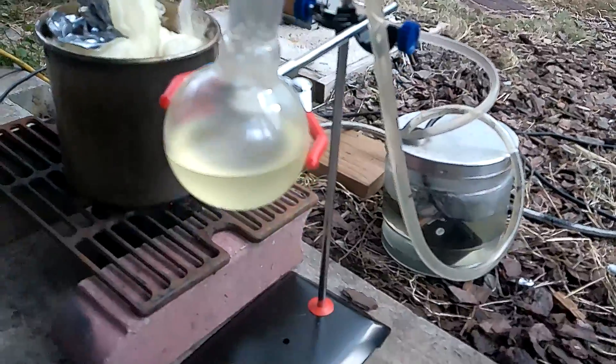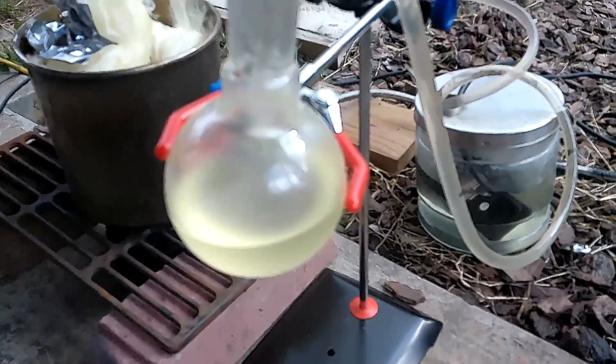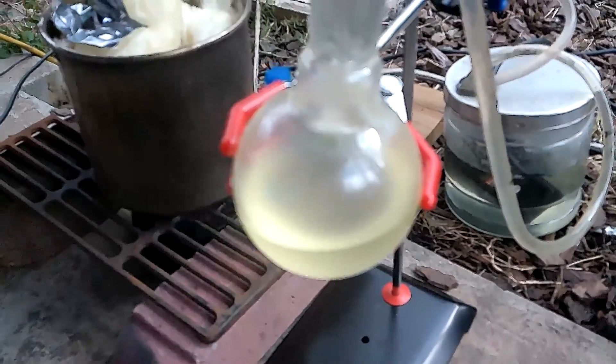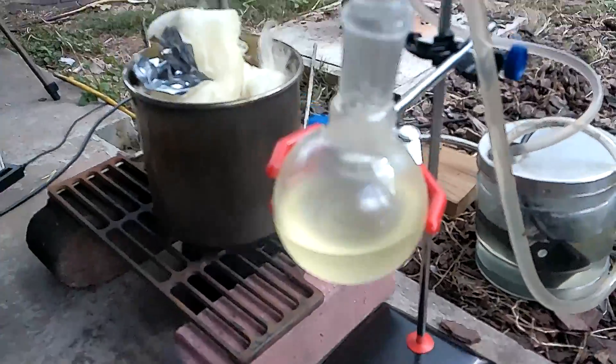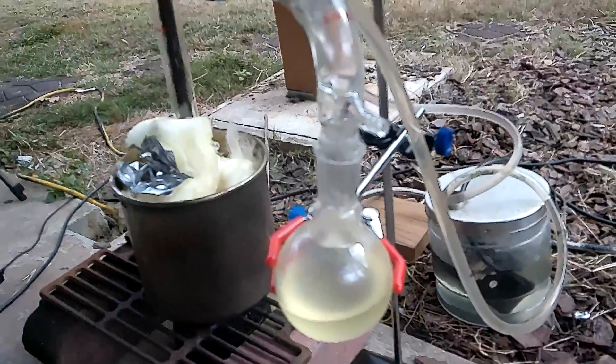I do like what we see. We're going to test this out and see if it has a low flash point like gasoline. Obviously it looks like gasoline — the viscosity looks really good. Pretty much no water in there, very little water — purely oil. So we're going to test this out and I'm excited.